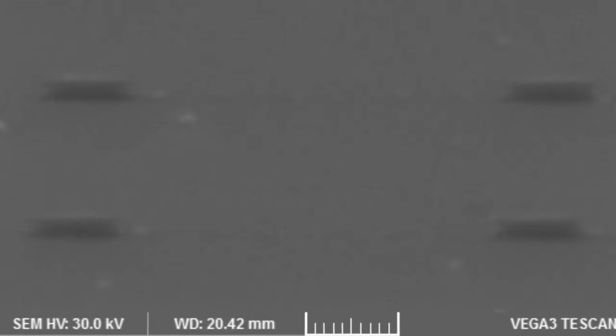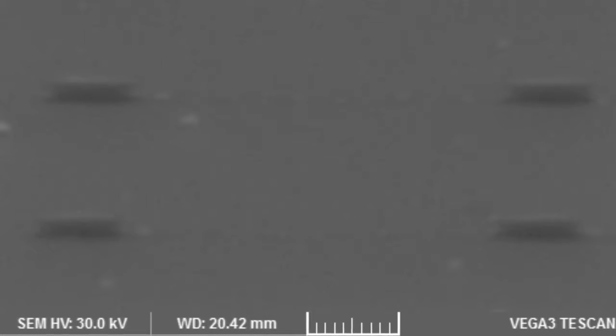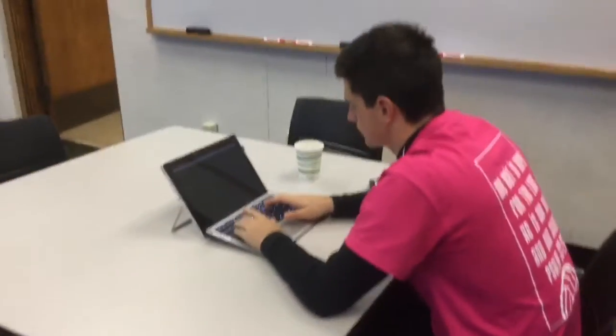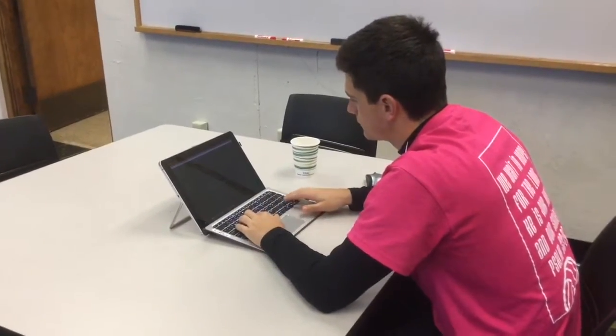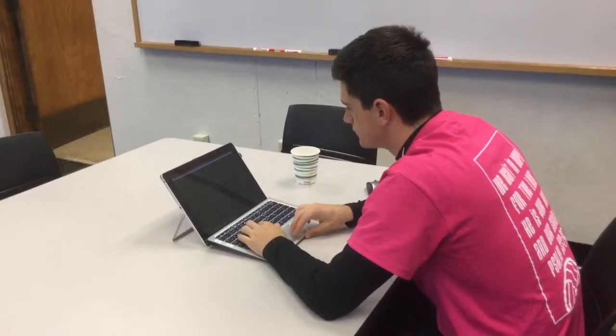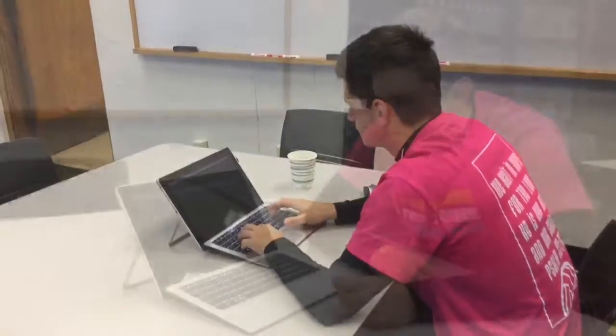But for Zach to get these photos at all requires a masterfully calibrated machine. That's where Ryan comes in. Ryan is writing a master program to keep everyone's research parameters within safe bounds. And by everyone, I mean everyone.